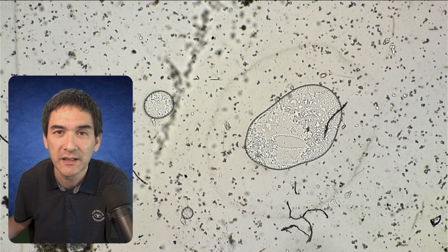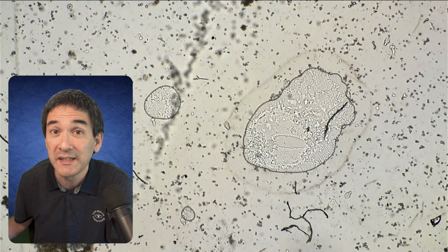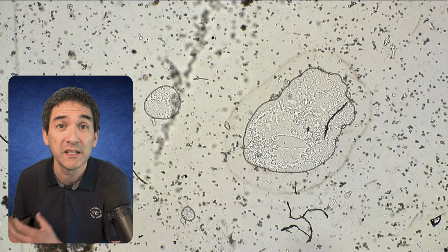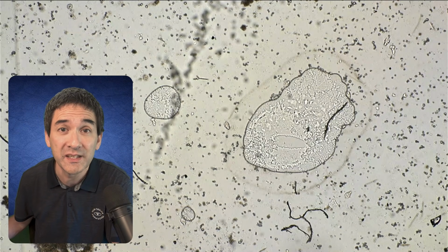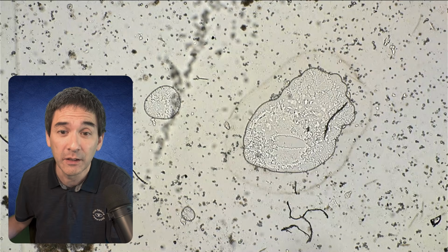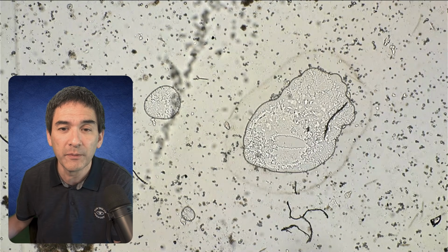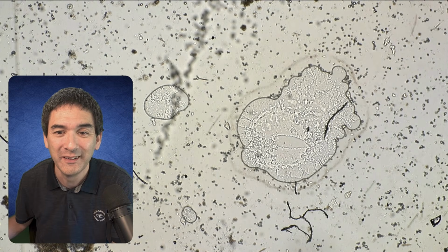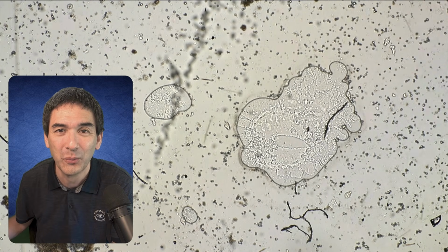And you can see that the air bubble is expanding. Now that's an artifact. The reason the air bubble is expanding is that as the water evaporates, it's being pressed flat by the cover glass, so we just ignore that. But more interesting is this ring forming around the air bubble. And not only that, the ring is also moving towards the air bubble.